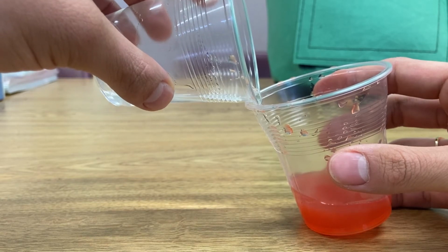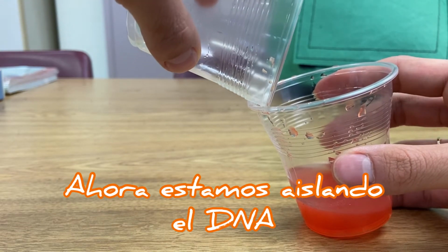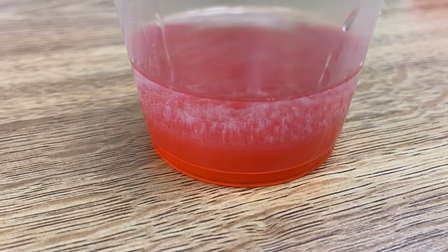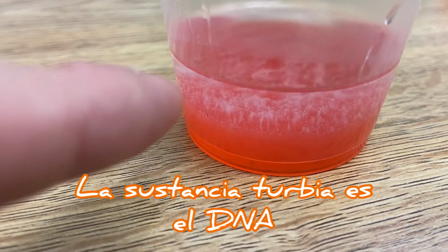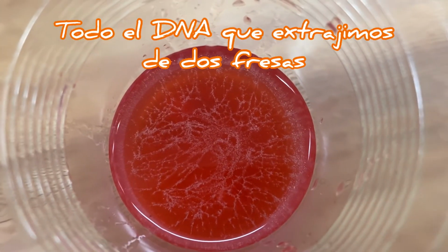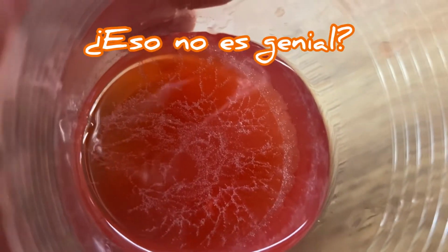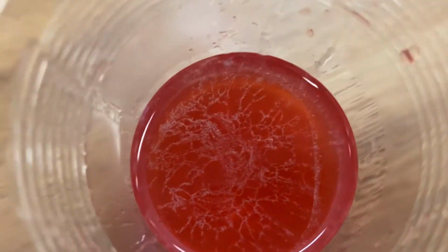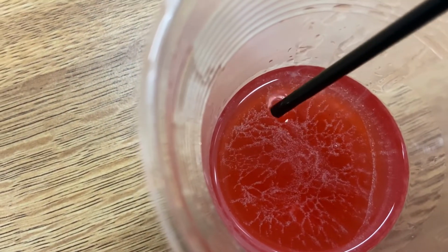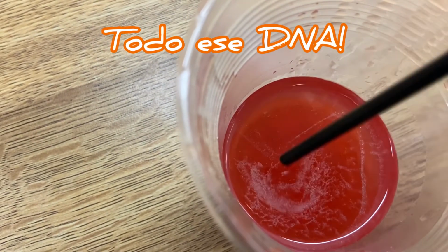Because right now, we have just isolated the DNA. And look, y'all, you see that cloudy substance? That is all the DNA we were able to extract from just 2 strawberries. Like, isn't that so cool? And I did it on my first try. I was surprised. I thought I had to do it over and over again. Here, I'm gonna take my stir. Yeah, look at all that DNA. Crazy.